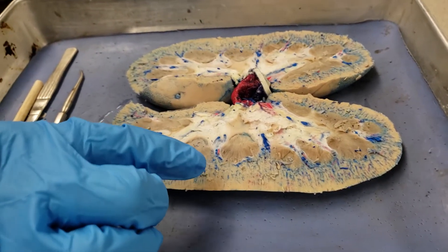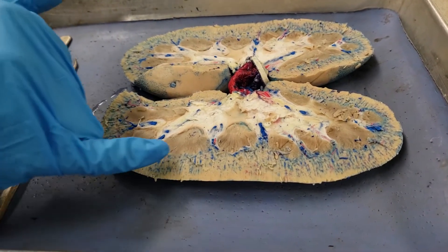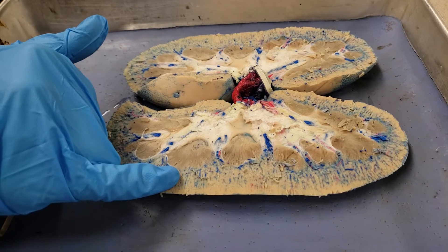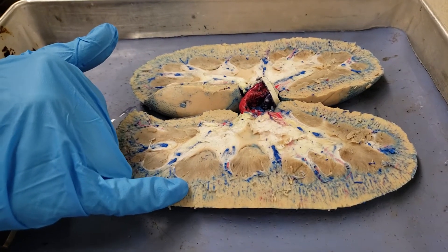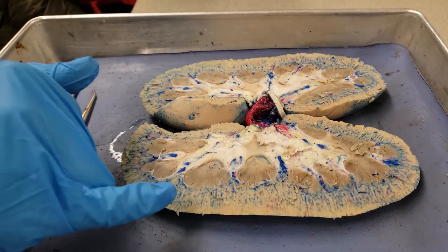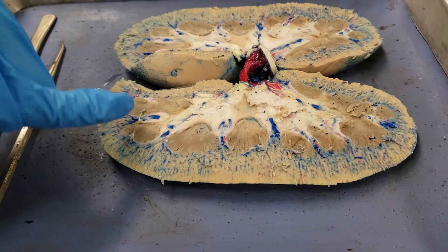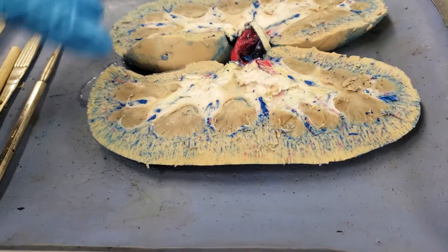Arcuate artery or vein — it'll specify red or blue. The cortical radiate just look like little lines coming out. They could ask about the cortical radiate and what it connects to — and you'd say the afferent, because it goes into the afferent.